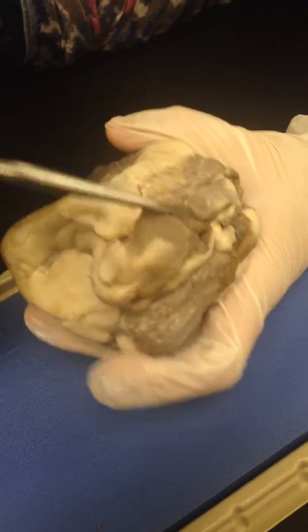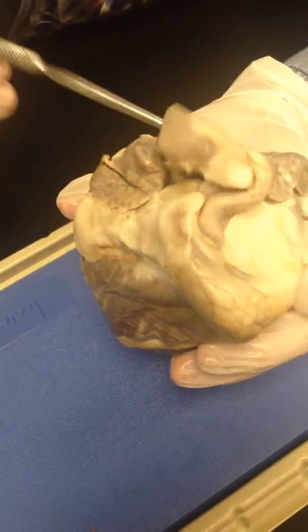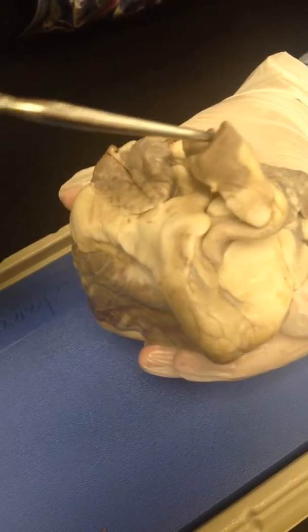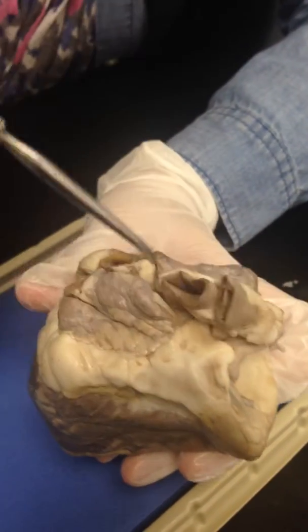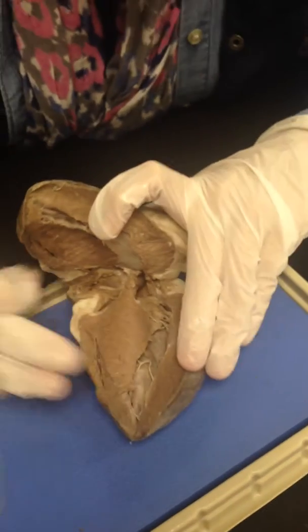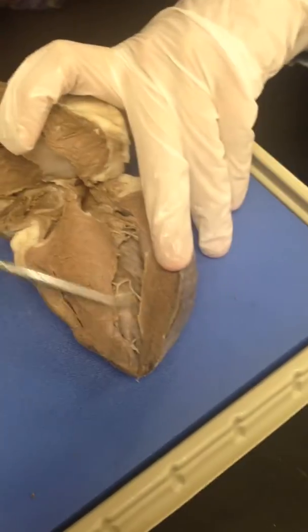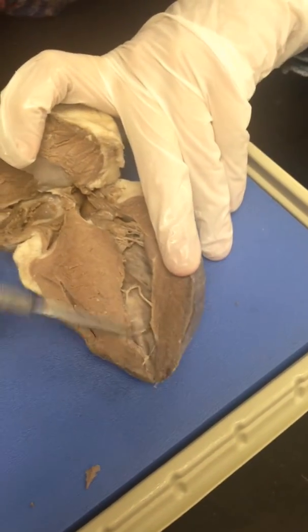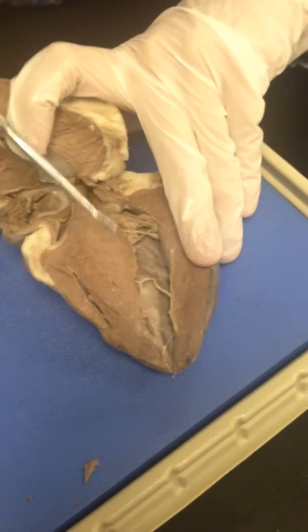So from the aorta, it will pass all the way through the body. So that is the aortic arch. If you can see three little holes: one hole, two holes, and three holes. Okay? And if we go back inside the heart, we can see that the ventricles are lined with endocardium, which is a lining. You can see the difference between this side and this side, quite different.